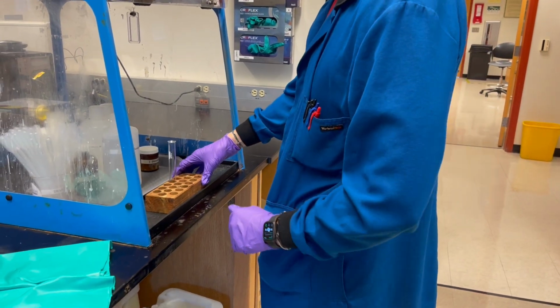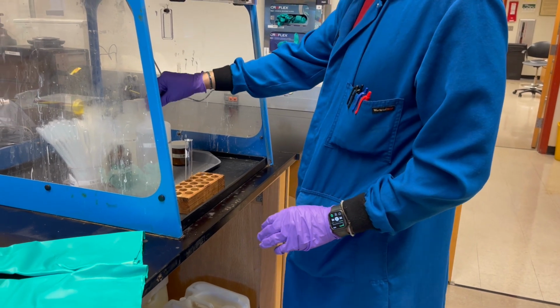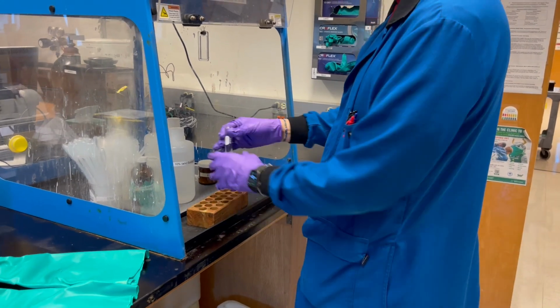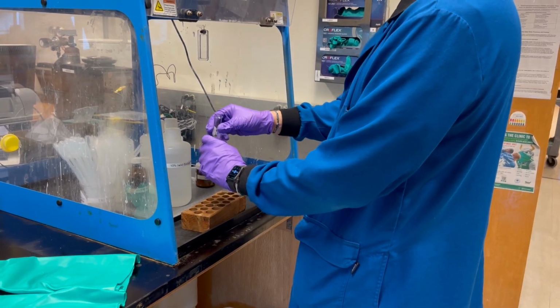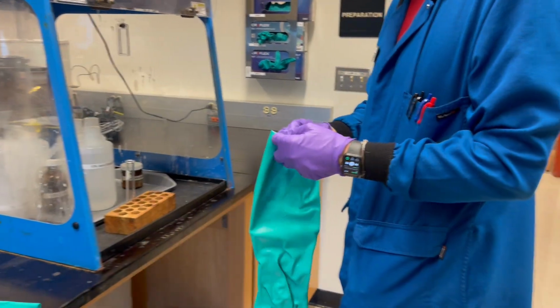All right, and make sure that whenever we're dealing with transferring a chemical from a secondary container into a test tube, that you always make sure that you use a test tube rack. If you don't use a test tube rack and you try and fill when you're holding the test tube in your hand, there's a good chance that you're gonna get it onto your glove, and depending on what the chemical is, it can leach through your glove, and you do not wanna deal with that.